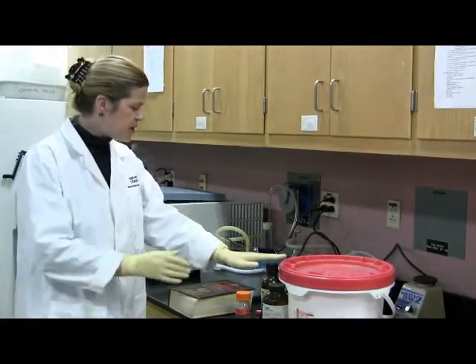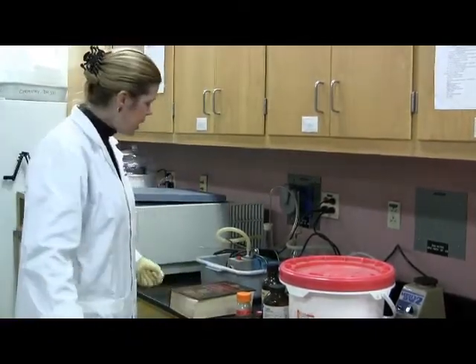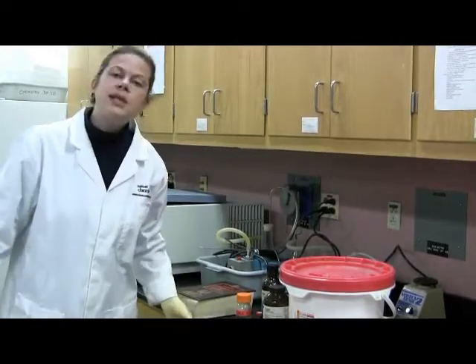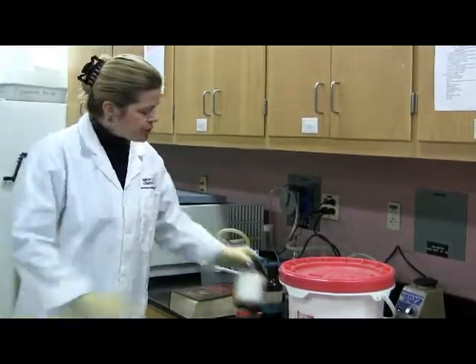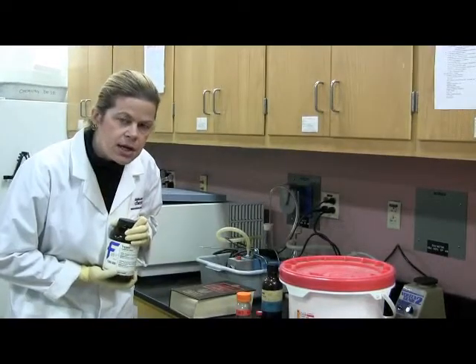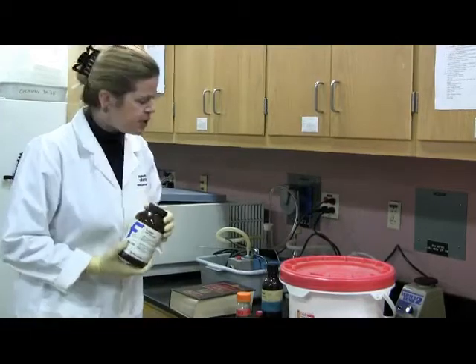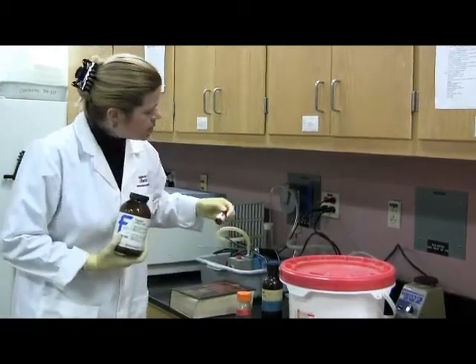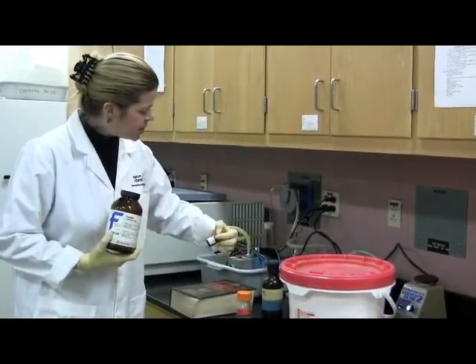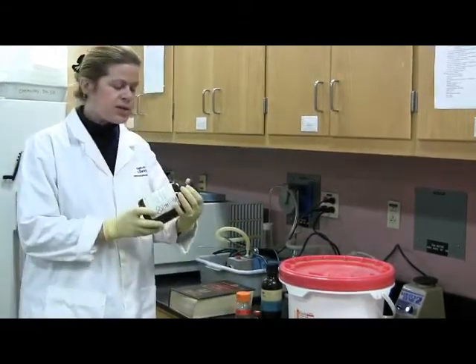So once you have your buffer and you have your substrate solution rolling away over there, okay, then we are going to prepare the enzyme solution. Trypsin is a protease. What does that mean? What kind of molecules does trypsin chop up besides N-alpha-benzoyl-DL-arginine, whatever it is? Okay. What kind of molecules does it chop up?